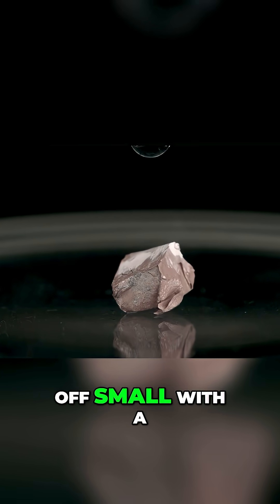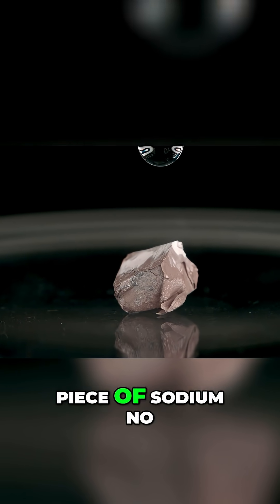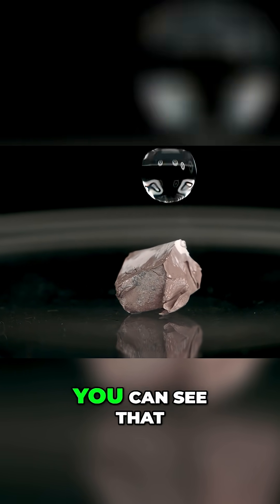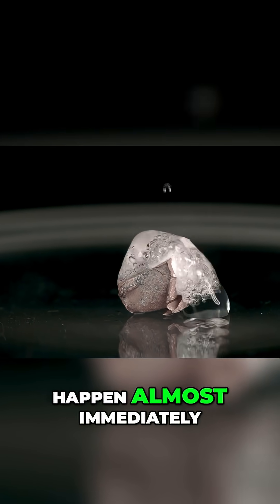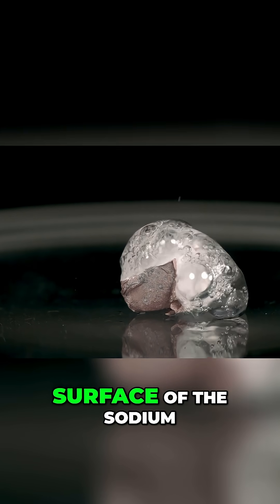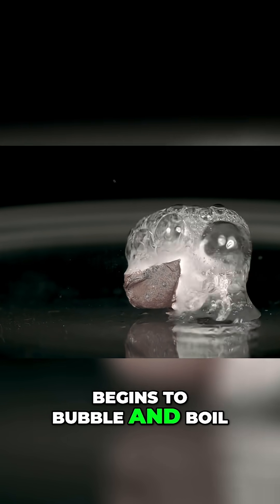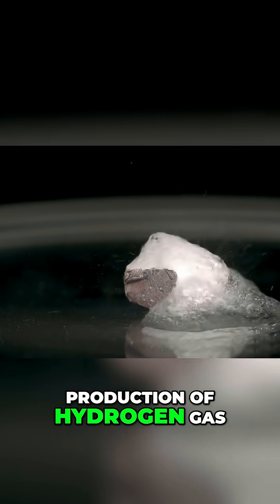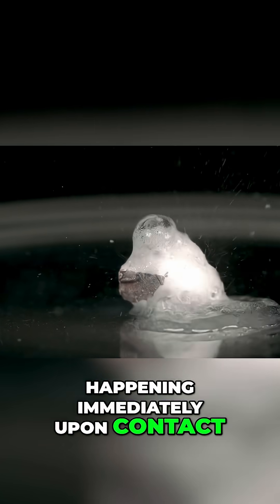I wanted to start off small with a macro shot of a piece of sodium no bigger than a pea. You can see that the reaction begins to happen almost immediately. You can see the surface of the sodium begins to bubble and boil, which is really the production of hydrogen gas happening immediately upon contact.